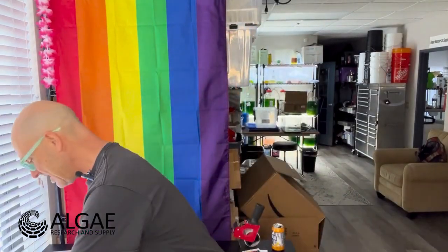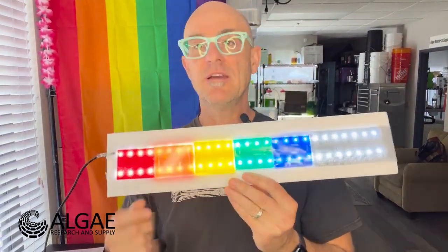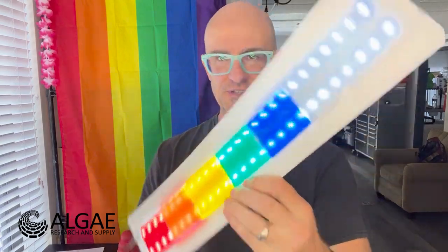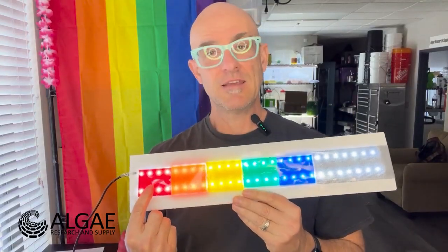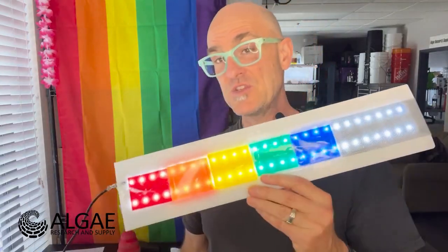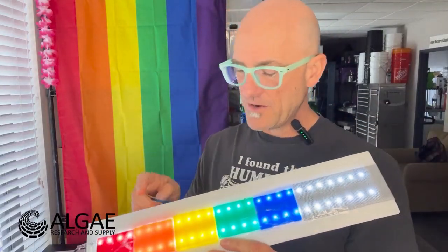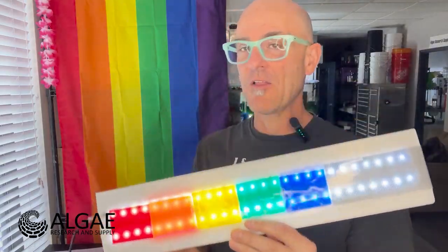We took our algae light, or our benchtop light here, and we put on different filters, including a neutral density screen, to try to get a red, orange, yellow, green, blue, indigo, violet light, or just green and blue at the end there, so that we could try to find out how the quality of light or the wavelength of light by the color affects the rates of photosynthesis. And we have some data on that.